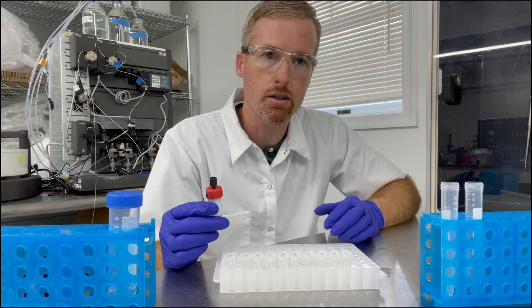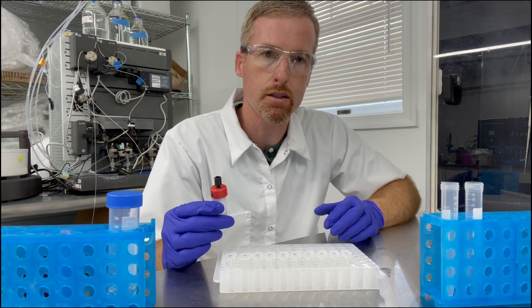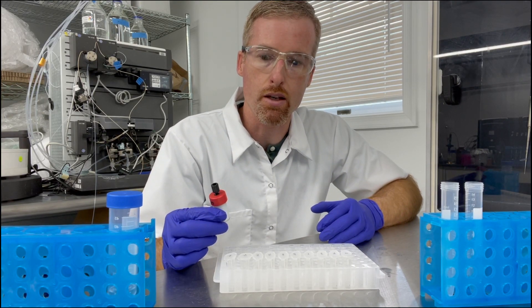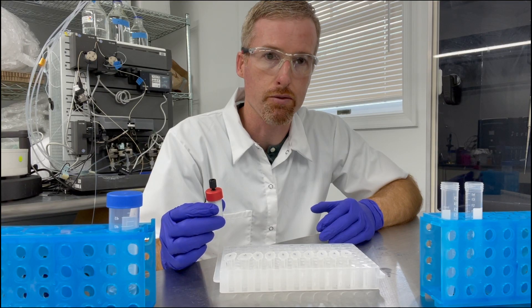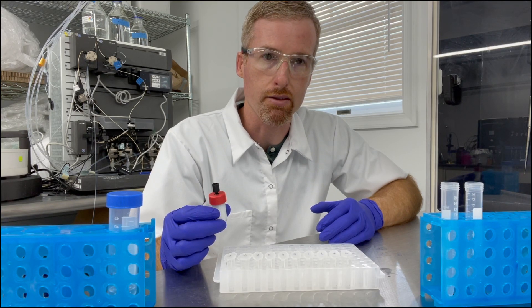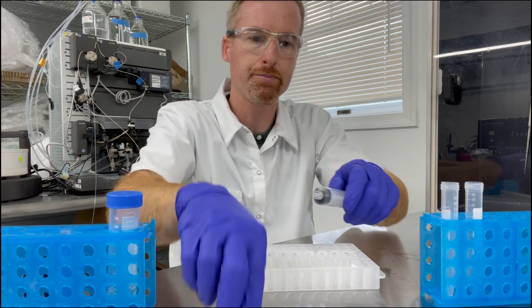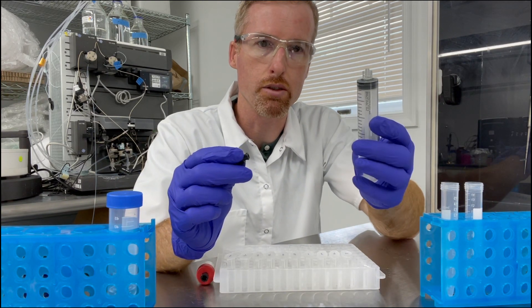Also we're not going to take any chances. I'm going to collect the protein as it flows through the other side of the column and that way if for some reason it doesn't bind to the column you still have it and it's not a big deal.